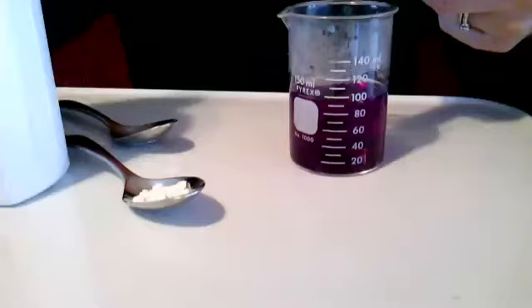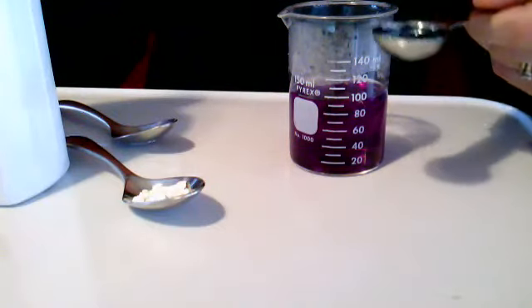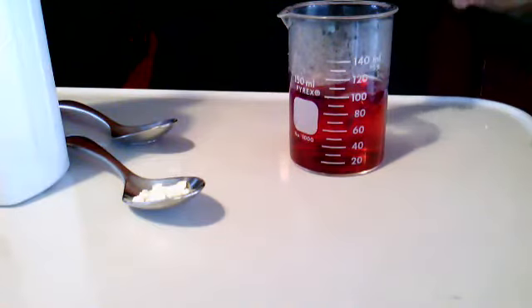And then we are going to add some Tums to it. Here's our Tums. And you're going to see what happens, and then you're going to tell me what the role of Tums is or what it does to our stomach. Okay, so the first thing I'm going to do is add some of our stomach acid. That's just a teaspoon of stomach acid to our indicator.